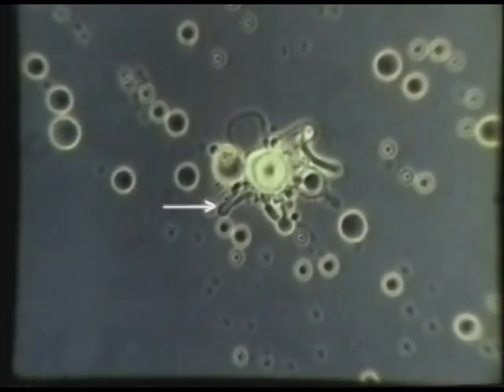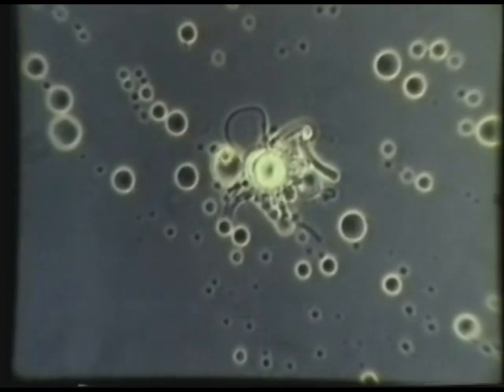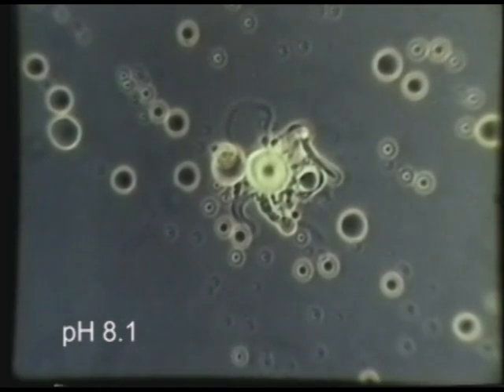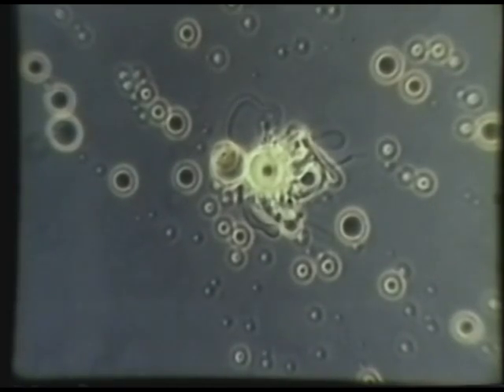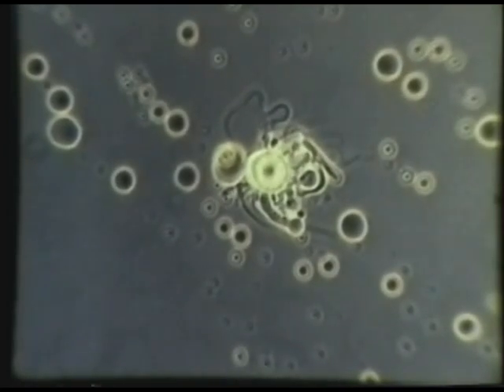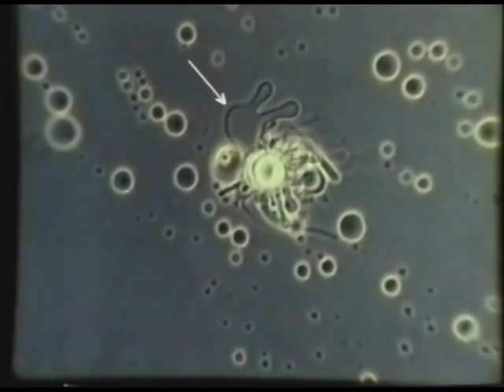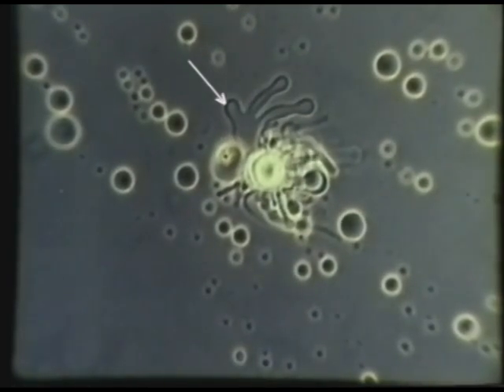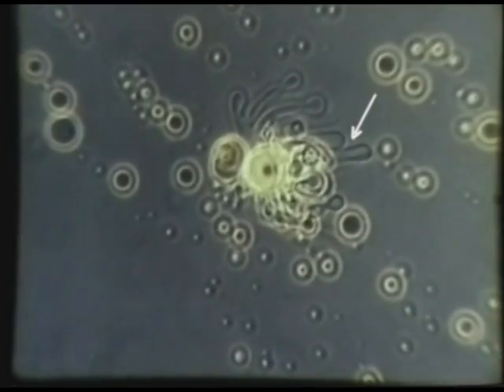Another tubule is projecting downward from the left margin of the large droplet. The broad, thin-walled structure above the lipid droplet is budding several tubules. Other tubules are projecting from the right margin of the droplet.